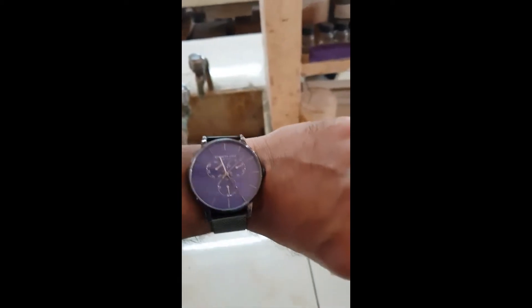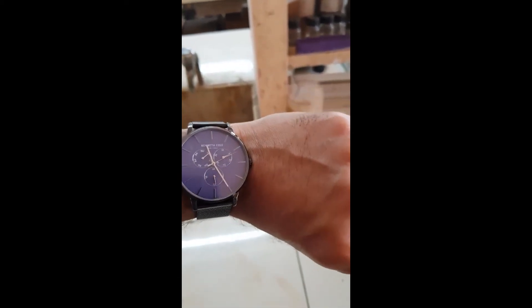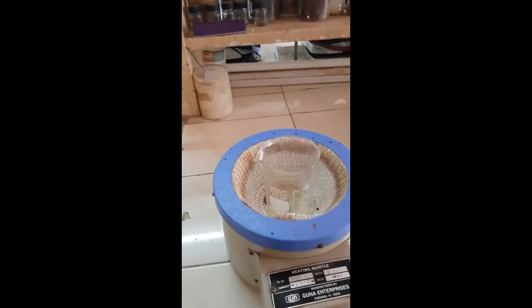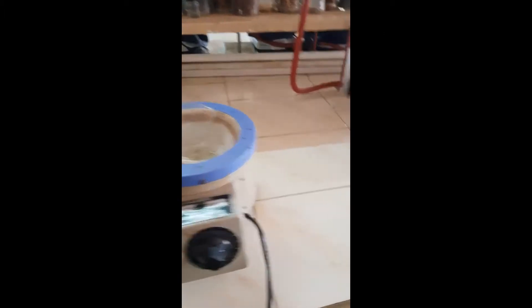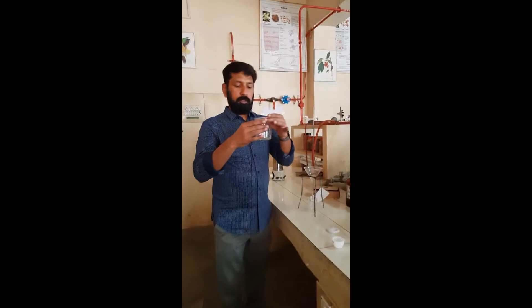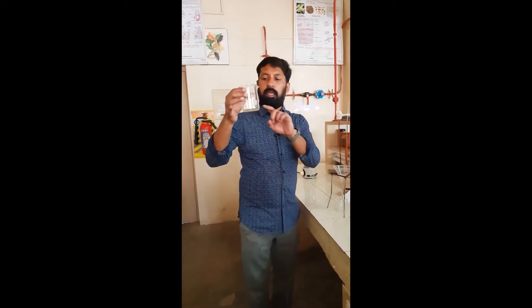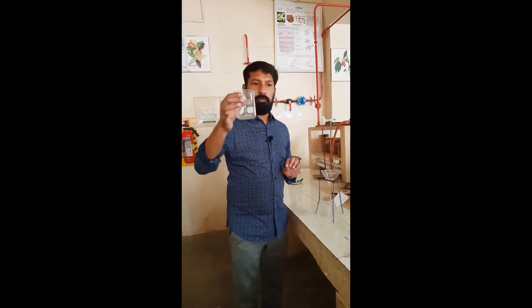Now after 15 minutes, the time is exactly 11:25. We kept it at 11:10, and now after 15 minutes at 11:25, we are going to switch off the mantle. We are removing this. This now contains 25 ml of dilute hydrochloric acid and the total ash — we dissolved it, and after heating we remove it.